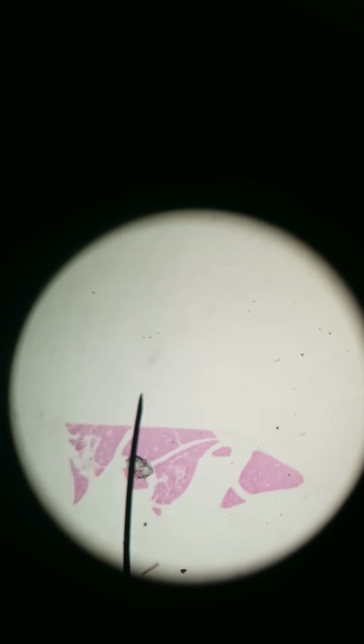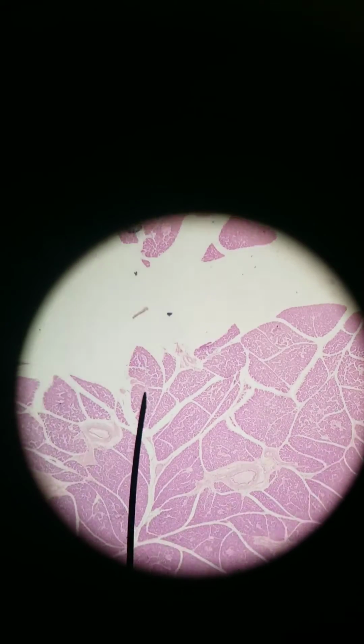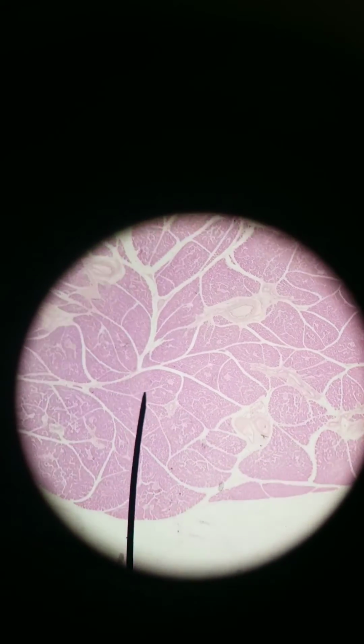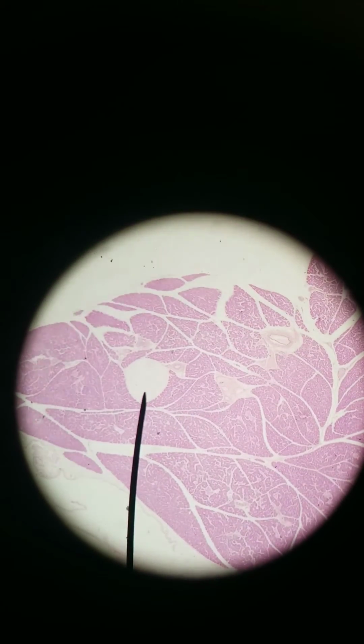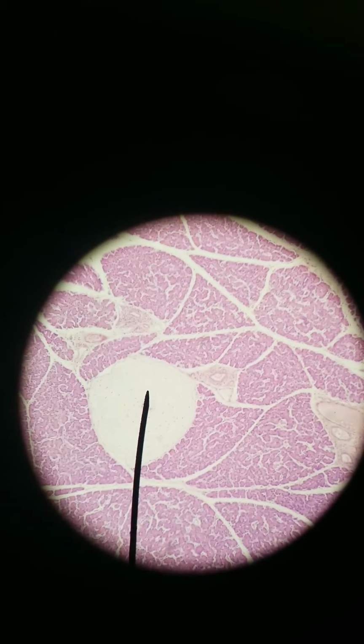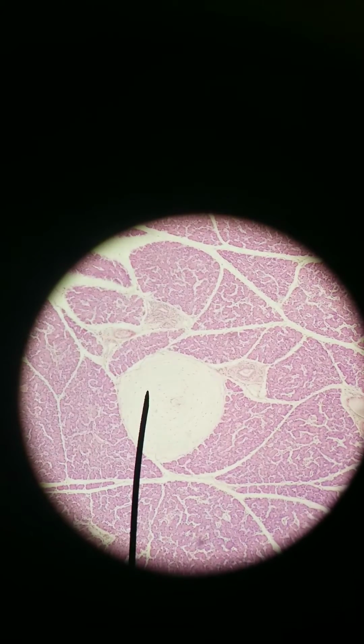One more receptor from the skin is the Pacinian corpuscle. Pacinian corpuscle is found deeper. It's found either in the reticular layer of the dermis or even the hypodermis. It's very, very deep. So here I'm at 40x. 100x is plenty, but you know what? I'll try for 400x. Yeah, we're actually too close here.